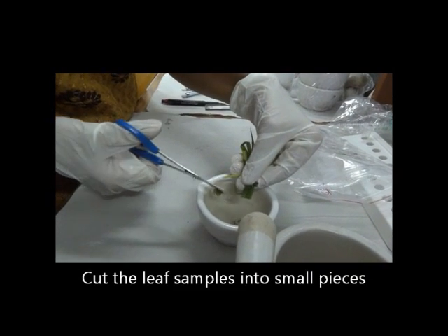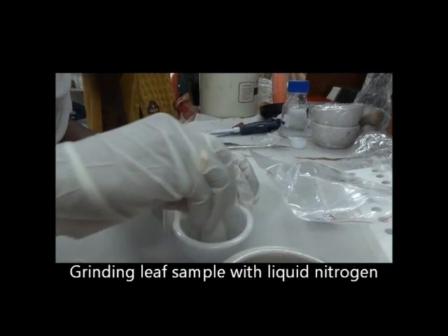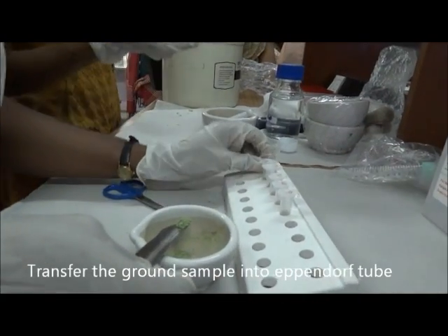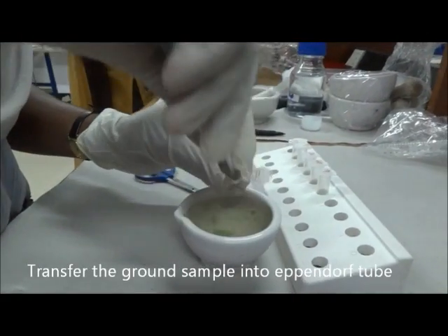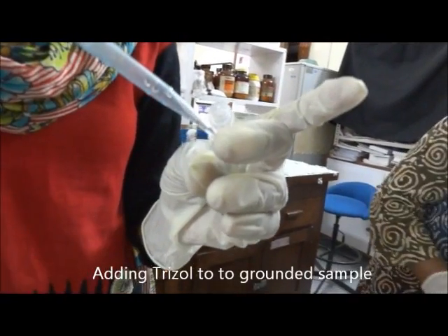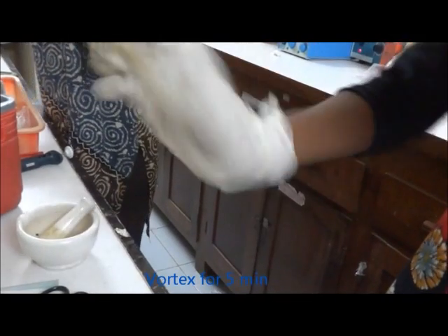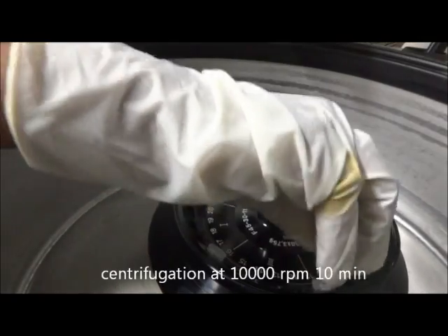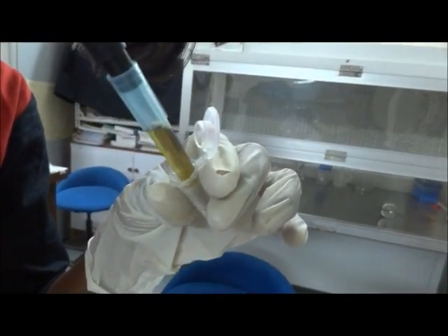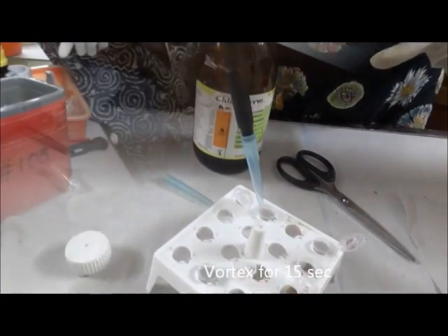Cut the wheat leaf samples into small pieces and grind with liquid nitrogen into fine powder. Then transfer the ground leaf sample into an Eppendorf tube and add 1 ml of Trizol solution. Vortex the Eppendorf tube for proper mixing. Centrifuge the sample at 10,000 rpm for 10 minutes. Collect the supernatant into a fresh Eppendorf tube, add 200 µl of chloroform, and mix by vortexing for 15 seconds.